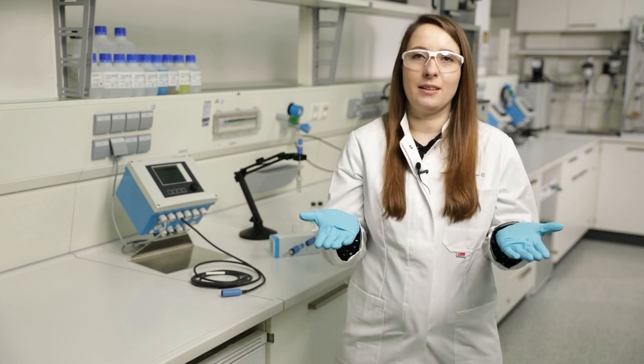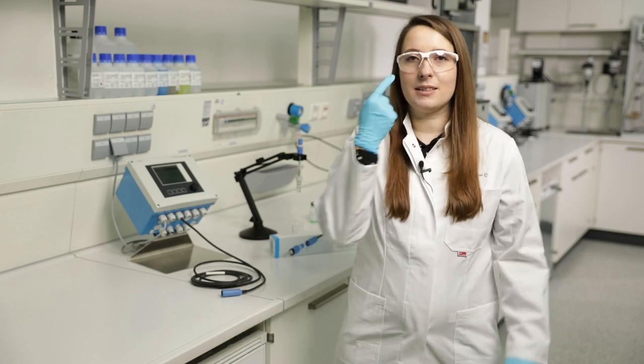Please remember, always wear your personal safety equipment before you start to work: your chemical resistant gloves, your safety glasses, and a coat. Now let me guide you to the commissioning of a CPS11E sensor.